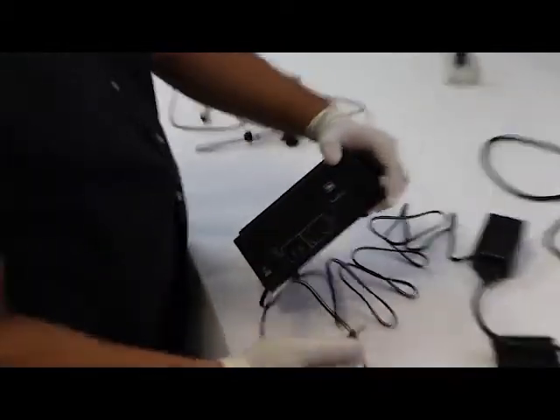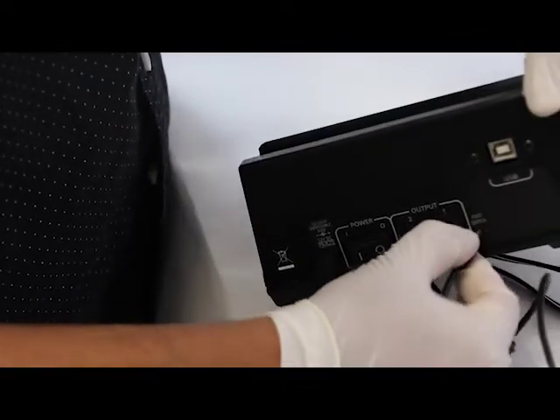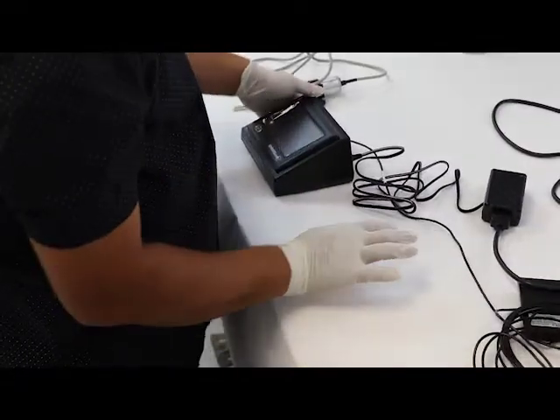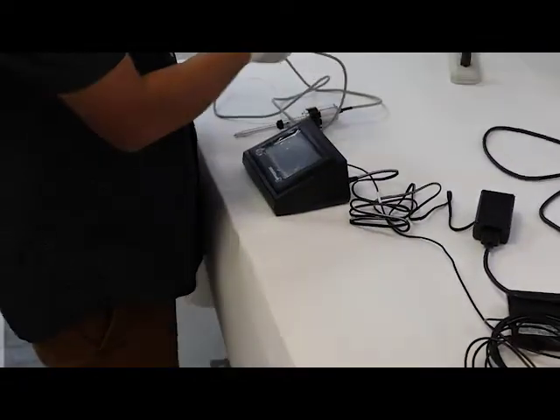The second thing we're going to plug in is the foot switch. Make sure we plug the foot switch into the correct cord component. And lastly we're going to plug in the nano-liter injector.